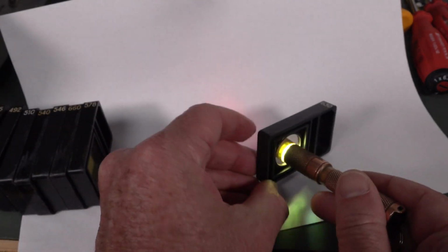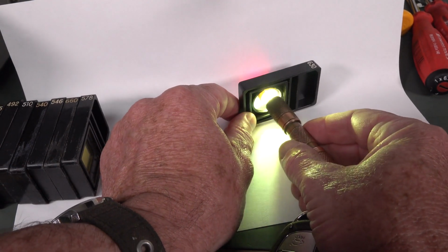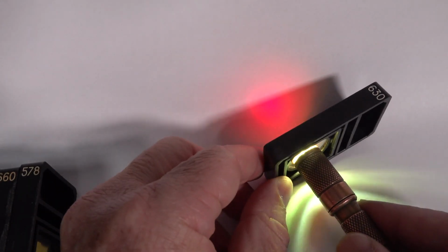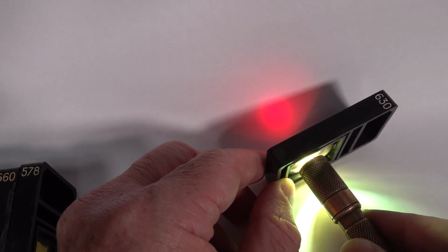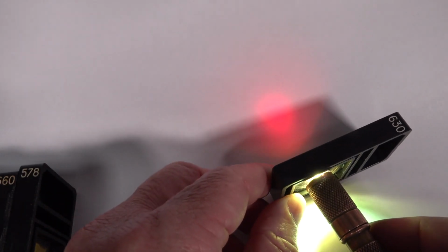Let's start with 630 nanometers, and you can see that it's red. Let me get in closer. So you can see that's red coming out the other side. So that's going to be 630 nanometers, plus or minus whatever that bandwidth is. This is a Lumintop torch, so it's not some linear calibrated thing, but it's going to be good enough for Australia.